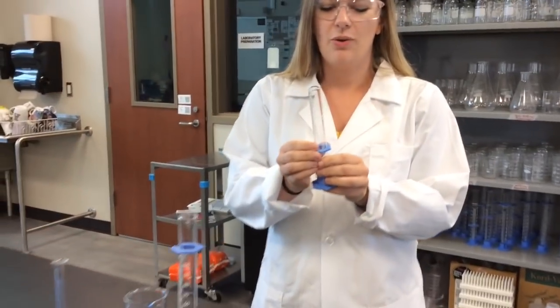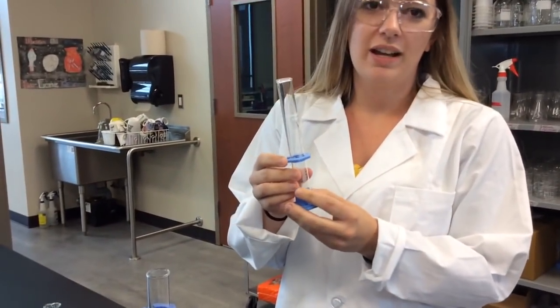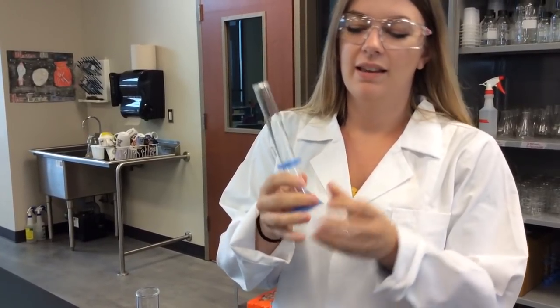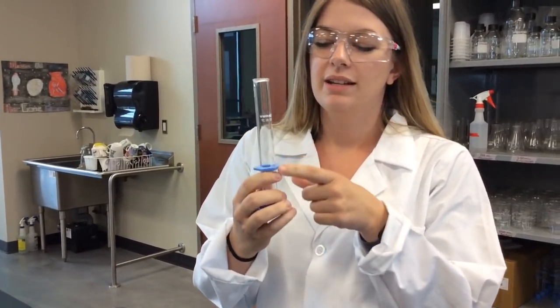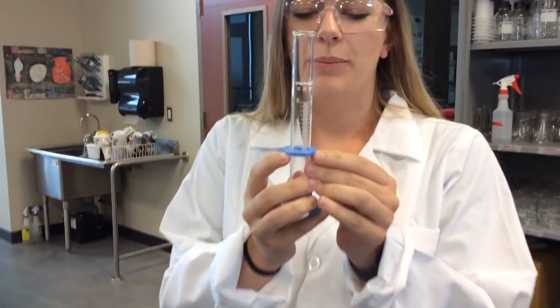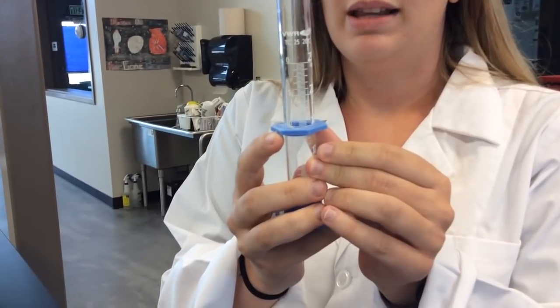So similar to the pipettes, we want to measure it so the meniscus is touching the bottom of the measurement. For example, if we want to measure out 10 milliliters, we will slide this cool little blue thing that helps us with measuring to 10 milliliters.